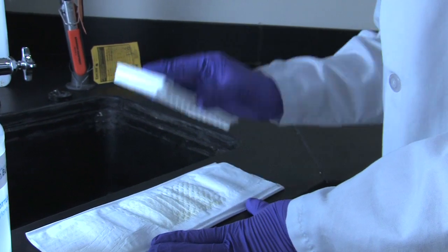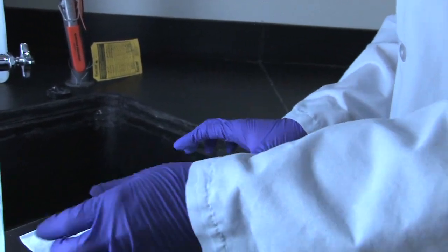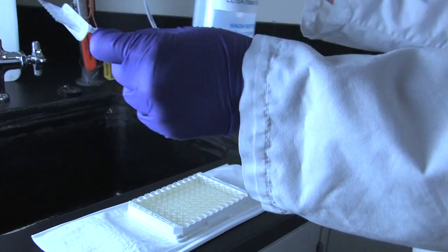Tap the inverted plate on a dry and absorbent surface to ensure all liquid content has been removed from the wells.